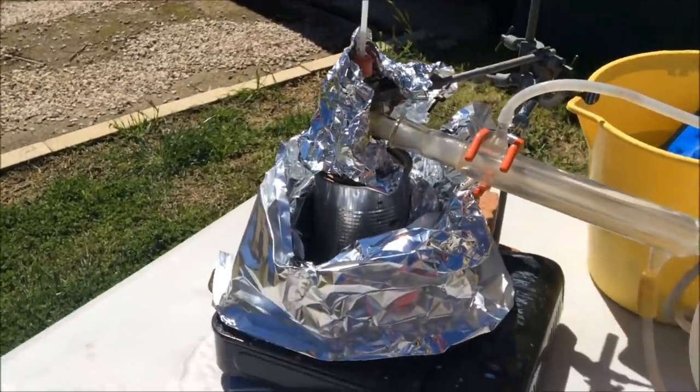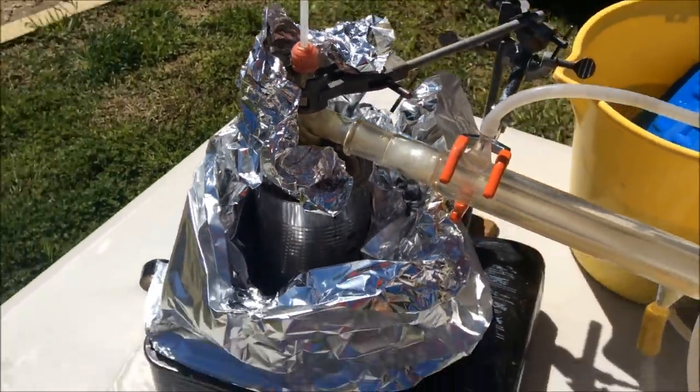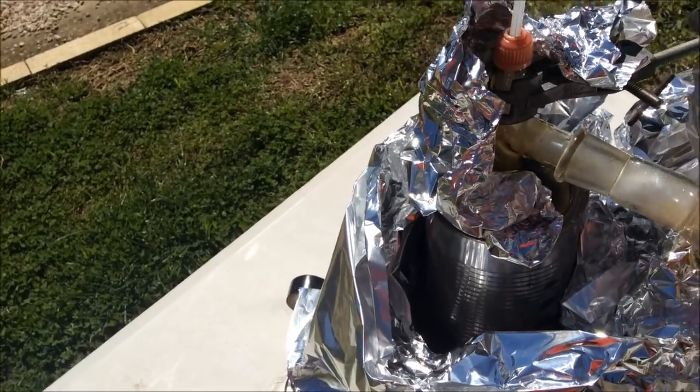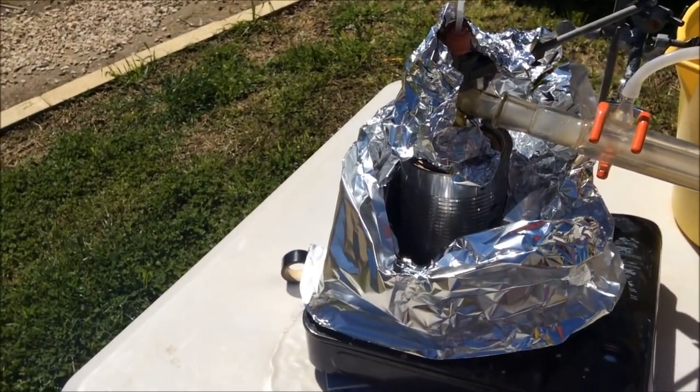There's a lot of white smoke going around, but that's just because this tape has melted, because that was the worst idea of all time, to put that electrical tape on there. I mean, to be fair, it has sealed the joint because it's melted all into the joint and it's fine, but it's just smoking like crazy and it smells like absolute crap.